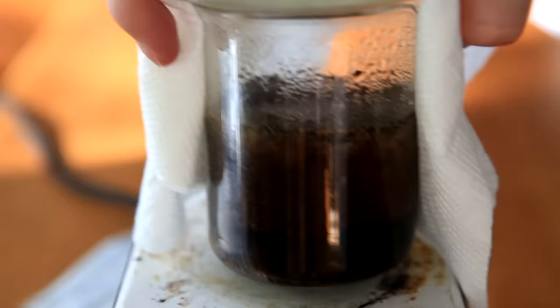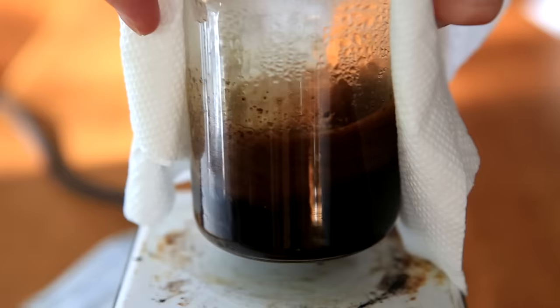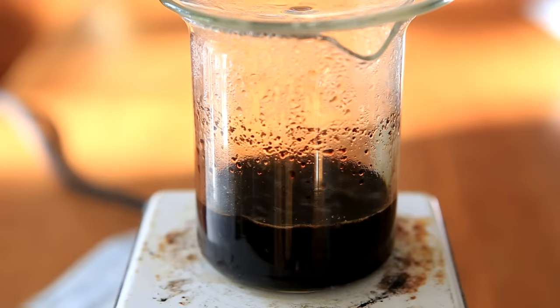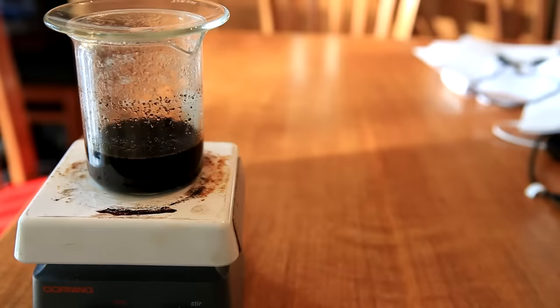As you see here, the solution has a tendency to foam a lot. To prevent it from foaming over, you can simply pick it up and shake it around a little. Foaming occurs when you are providing too much heat, so to remedy this you can turn down the heat and get a nice simmer like this.